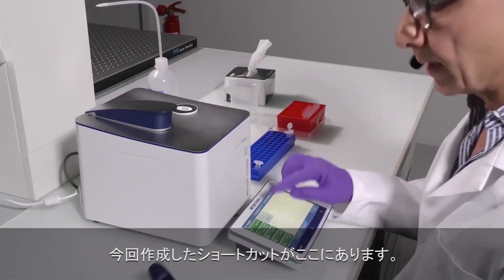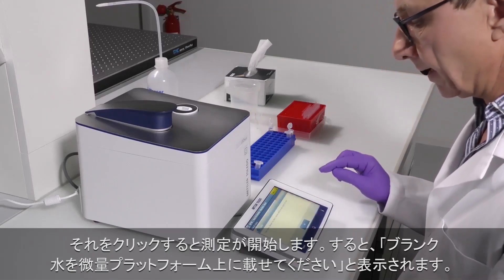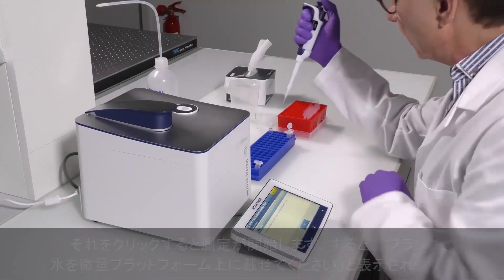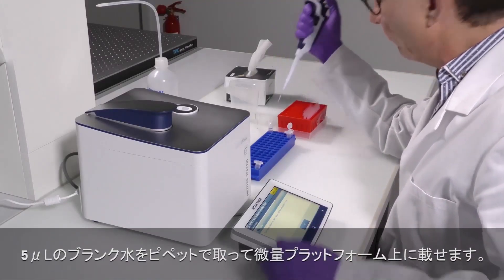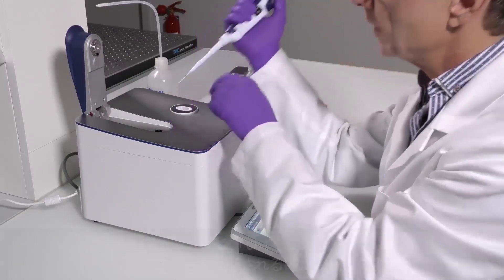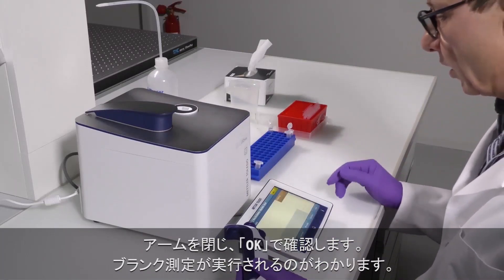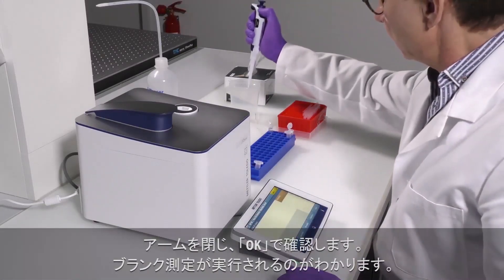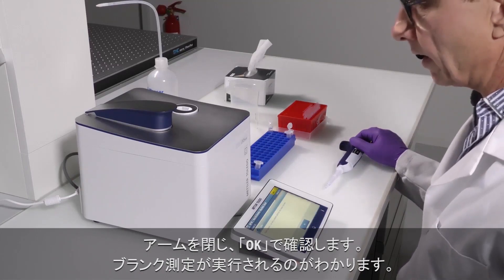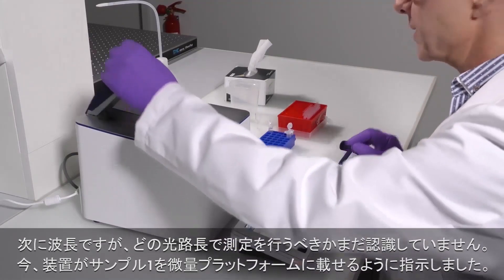You see here the shortcut I have created. I click on it and start it. Now it says: please put the blank — water — onto the microvolume platform. So I pipette 5 microliters of distilled water onto the microvolume platform. I close the arm and confirm. Now you see the blank measurement is being performed at all wavelengths, because the instrument does not yet know at which wavelength and which path length the measurement will be performed.